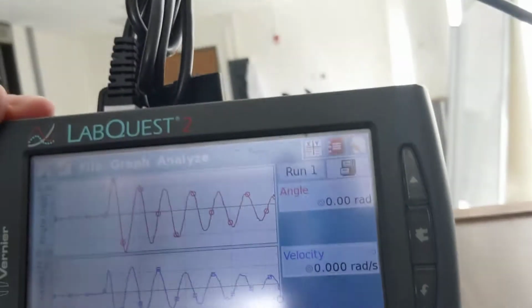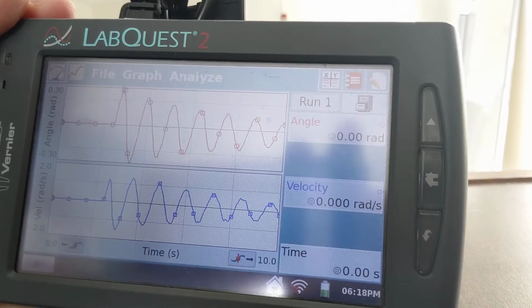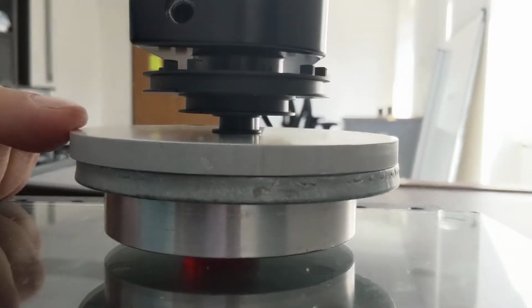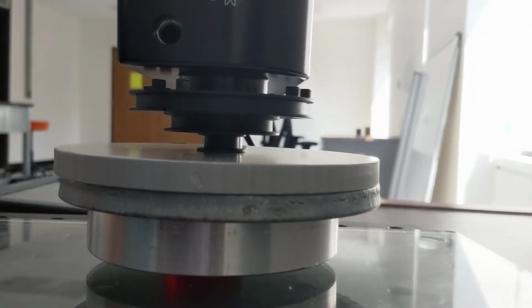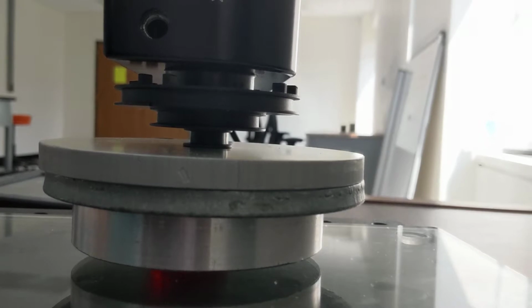And when we look at the data, there we go, you can see that sine curve, and we can make measurements of the period of that oscillation and the difference in amplitude from one peak to the next, along with information about the geometry of the disc and the geometry of the sample. And that will allow us to calculate the stiffness of the Jell-O that's under there, something that we call G prime.